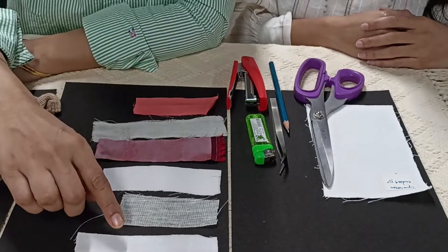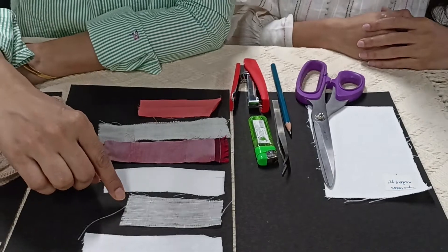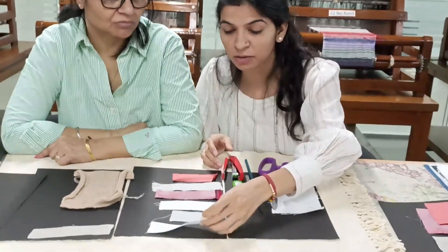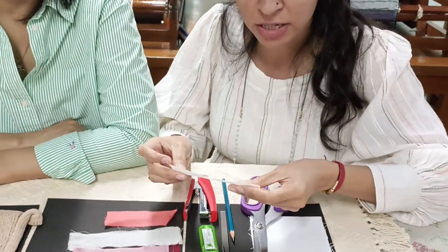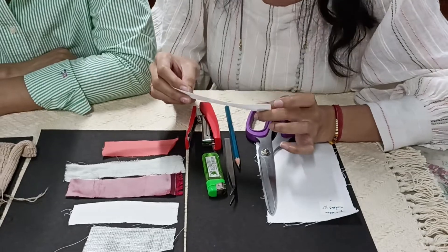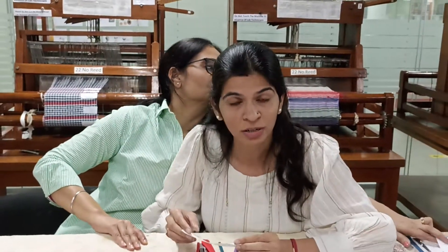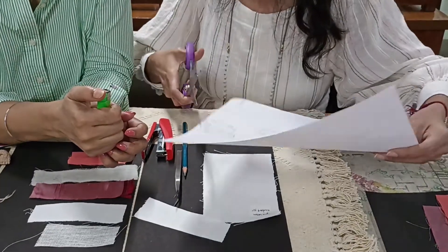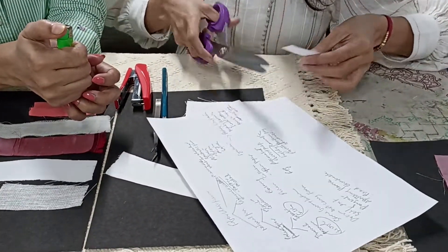Now the instructor will explain all the tests to show the burning behaviour of these fibres. First we will be starting with a cotton fabric and observe how different categories of fabrics with different fibre contents behave differently during the burning test. First, when we look at cellulosic fibres, being extracted from a plant origin, all of them will behave in a similar manner. Let's look at how a paper burns, because paper is also taken from cellulose, from plants.